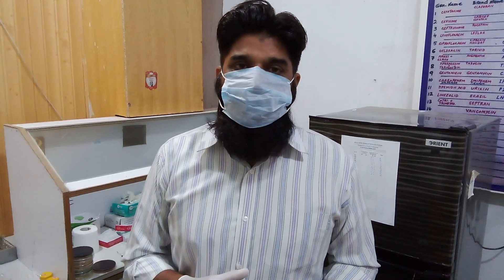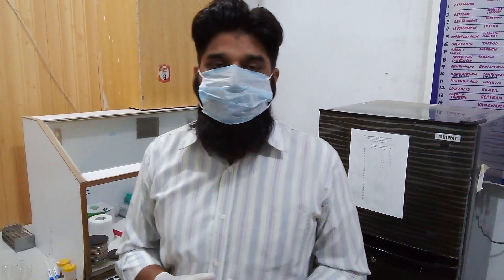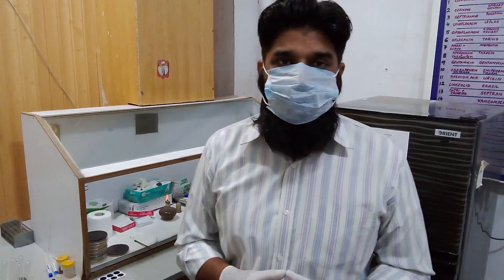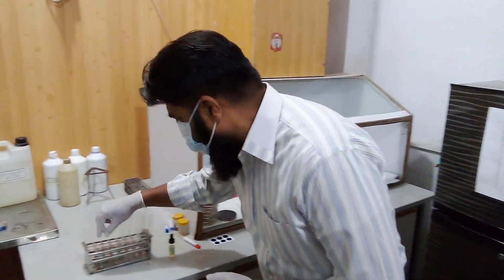Why does clotting occur? Clotting occurs because under the effect of coagulase enzyme, fibrinogen is converted into fibrin. This will be demonstrated in the coagulase test, so let's see.